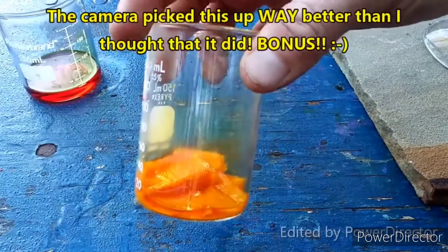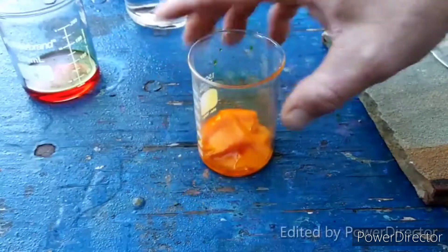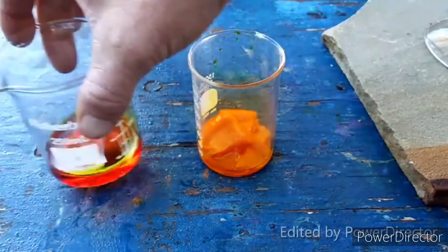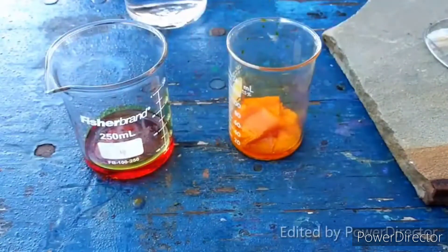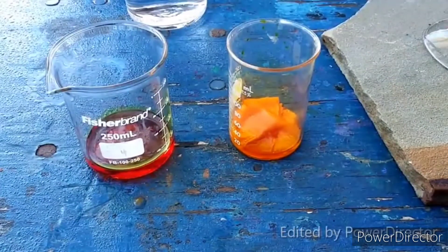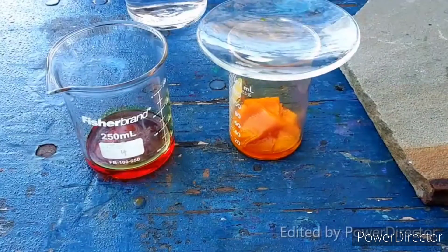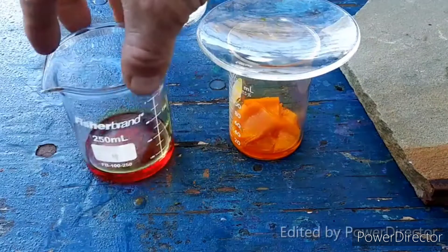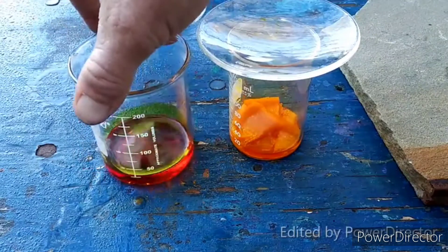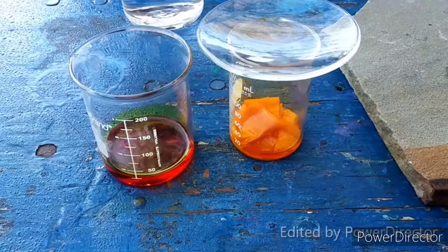That is fucking amazing. So this is obviously the solid. Here is the liquid — I just decanted this off just now, and I'm rushing to get it all on film because it is kind of hygroscopic, or at least it has been up until now. The textbook says for this last little bit of filtrate, we can crystallize out more of our product by adding alcohol to it.